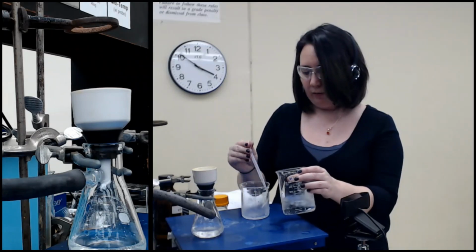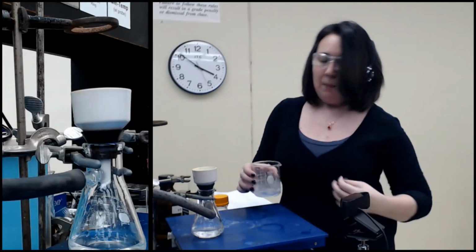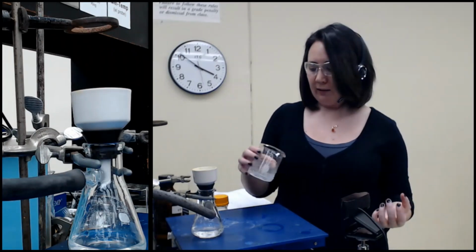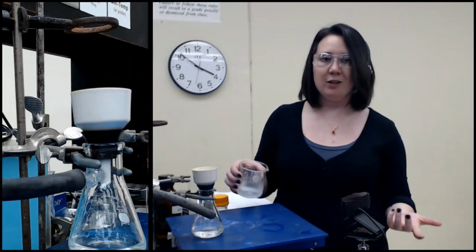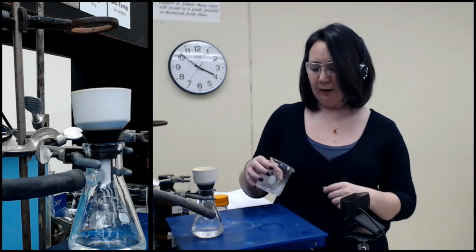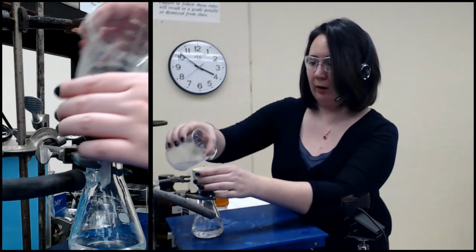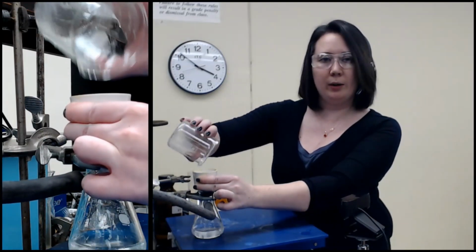I don't really worry that it's going to dissolve in the water in this case. Back when we did recrystallizations, you could very well accidentally redissolve the solid you just recrystallized, so you'd want to be careful how much solvent you add. In this case, I don't worry that it is going to dissolve, because it was only water soluble when it was deprotonated.